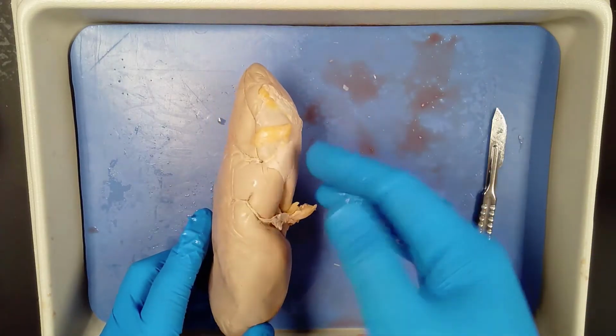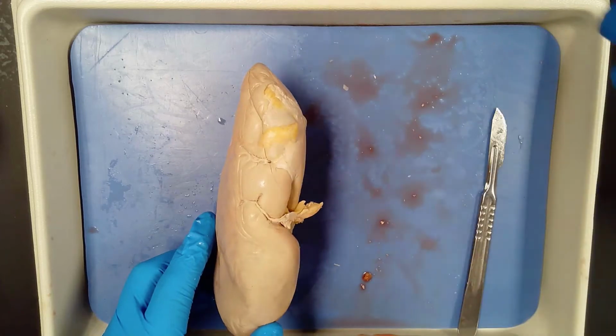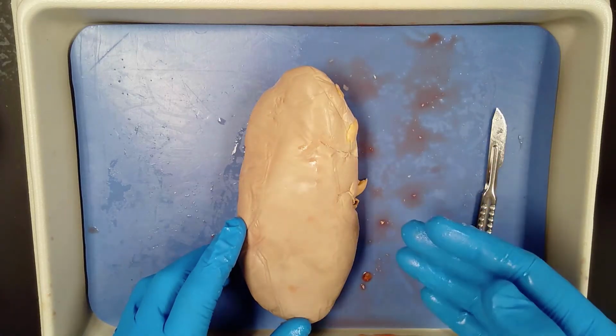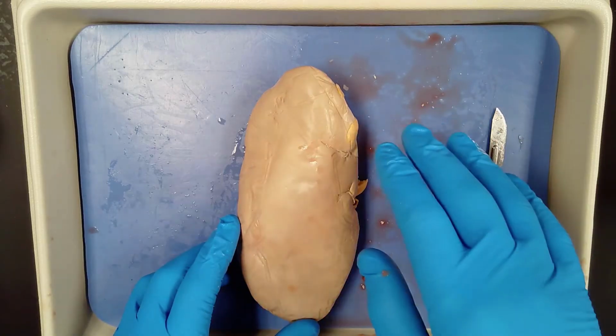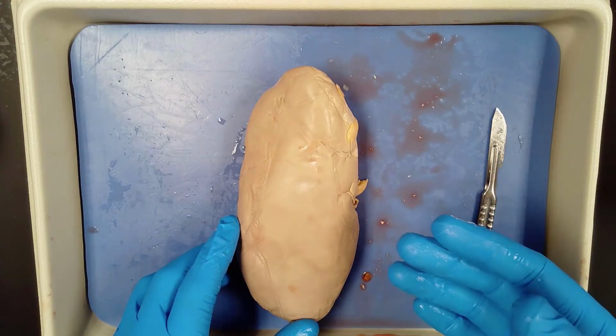waste out. So you have a renal artery. It's the one that enters into the kidney. So the renal artery brings the blood in. The renal vein exits the kidney with the filtered blood back into the system. And then you have the ureter that we saw on the anatomage table that leaves with the waste down into the urinary bladder where it's stored until it needs to be removed from the body.